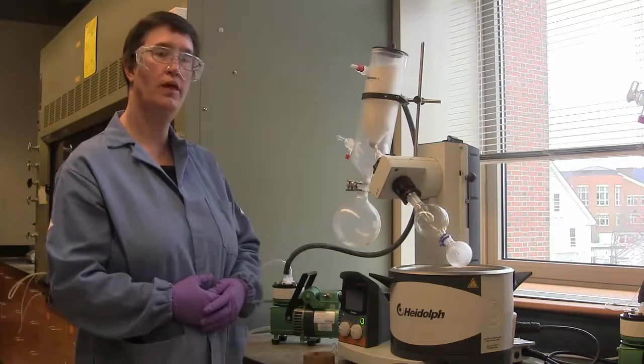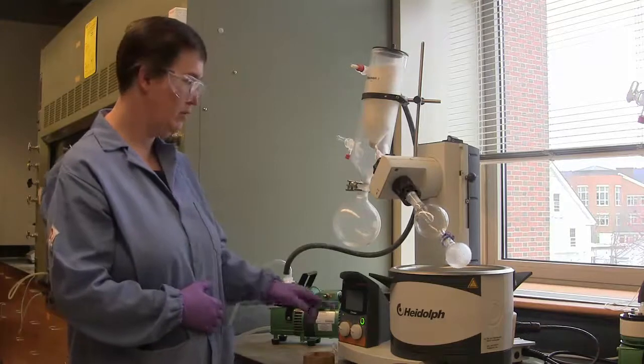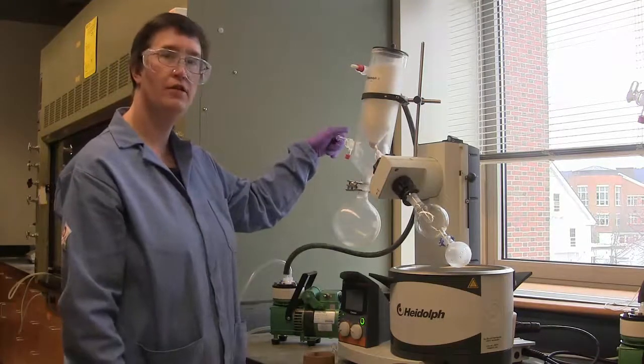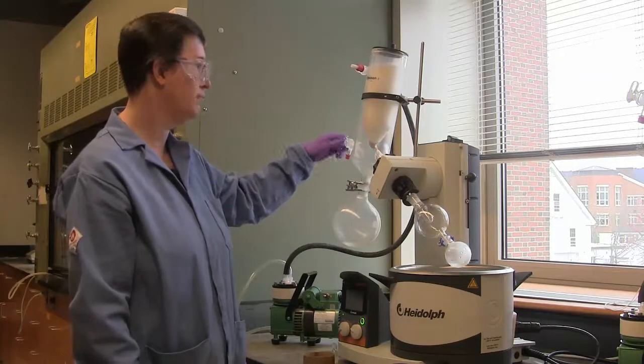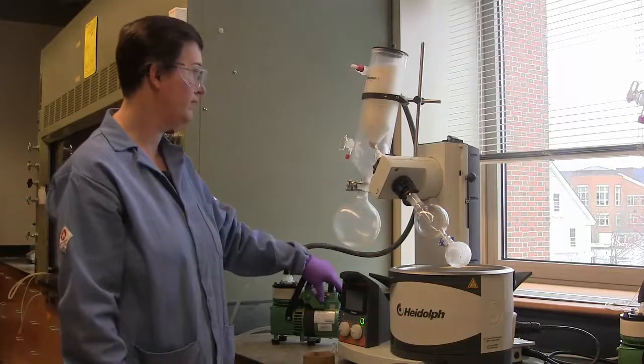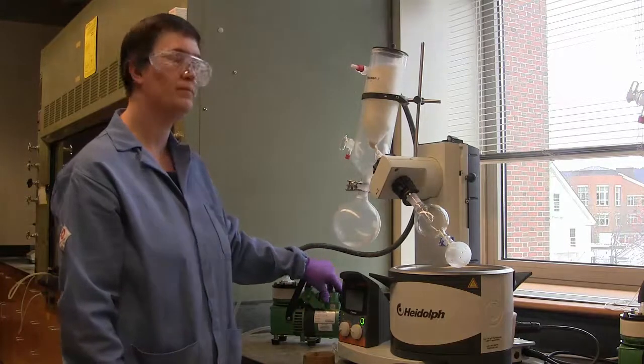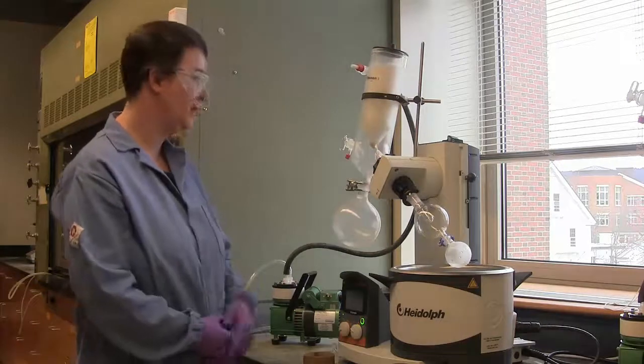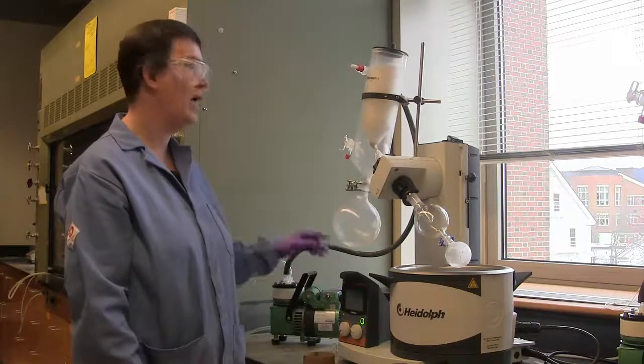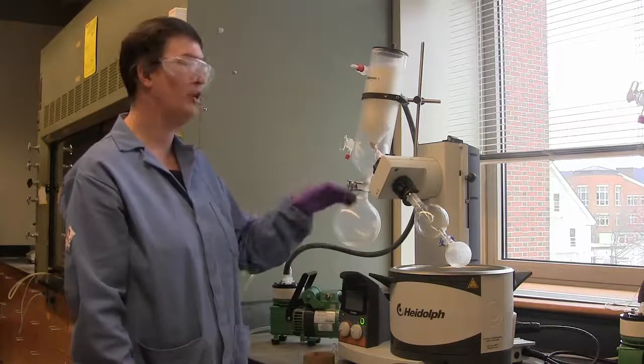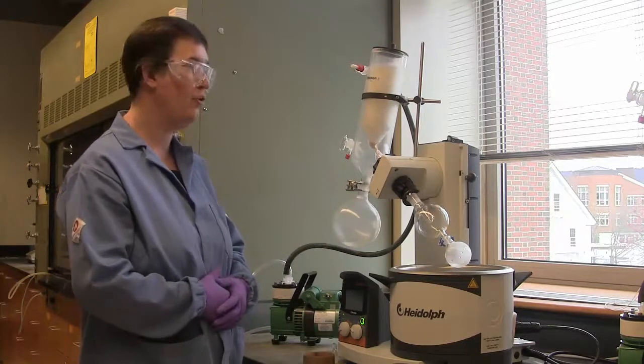When you've determined that evaporation is complete, stop the rotation and vent to atmosphere. After venting the system to atmosphere, I then turn off the pump, and I don't know if you can hear it on the video, but there was quite a bit of hissing as the pressure equilibrated within the rotary evaporator.